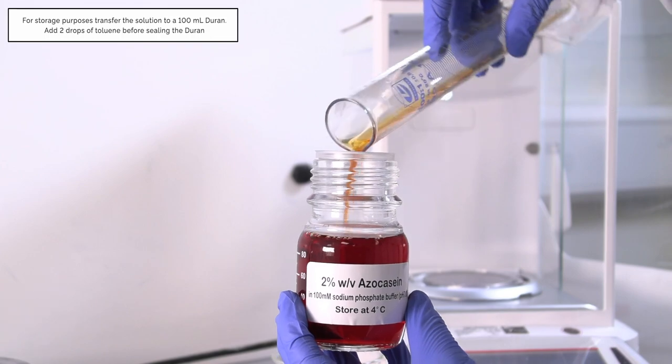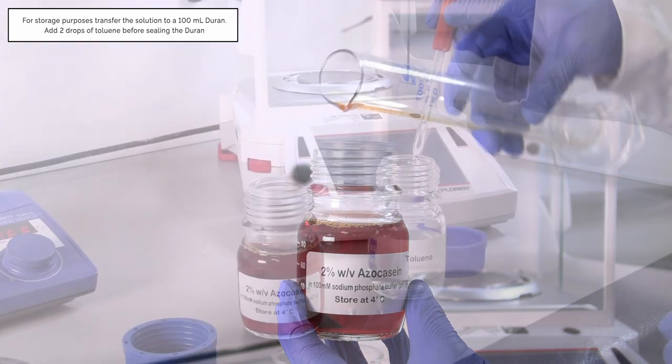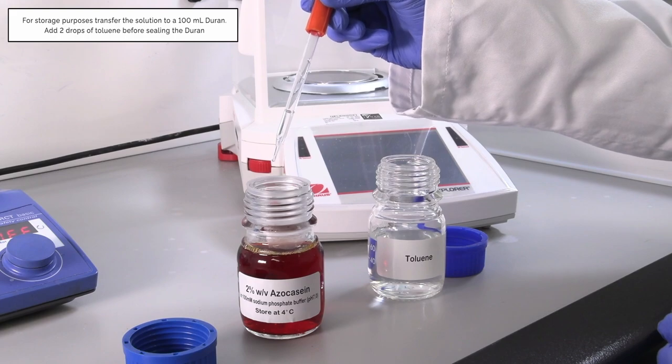For storage purposes, transfer the solution to a 100 milliliter duran. Add 2 drops of toluene before sealing the duran.